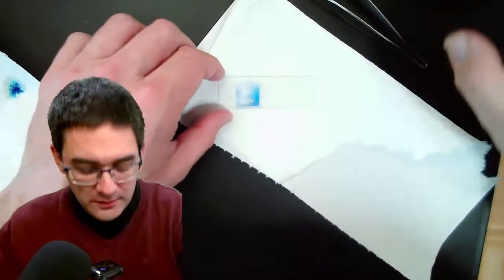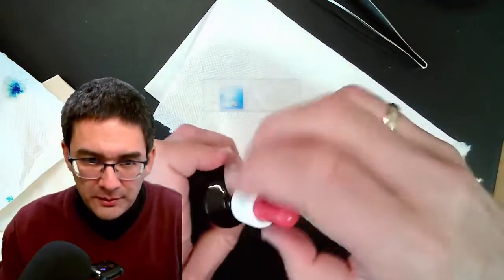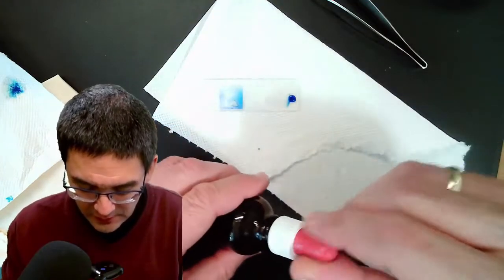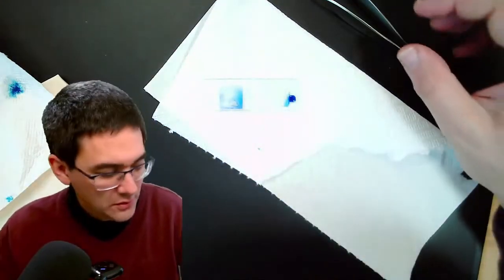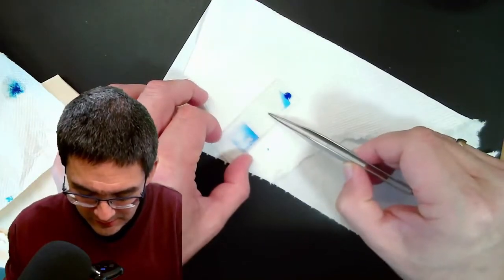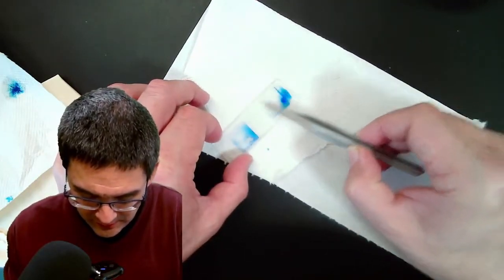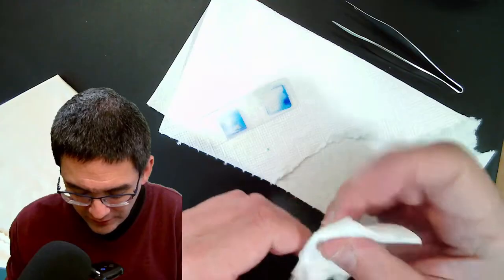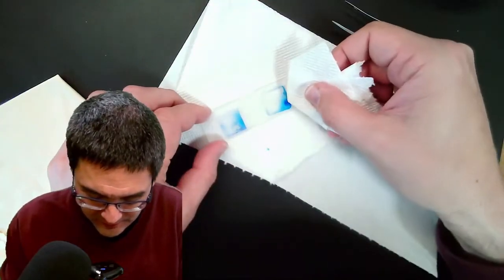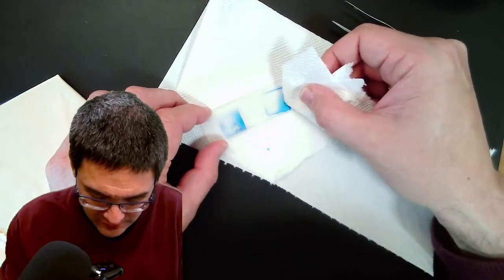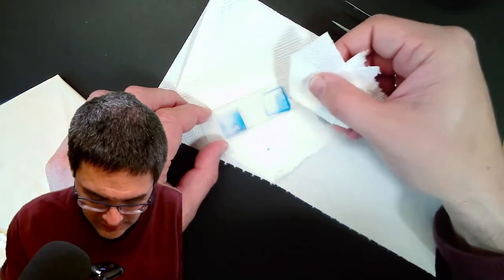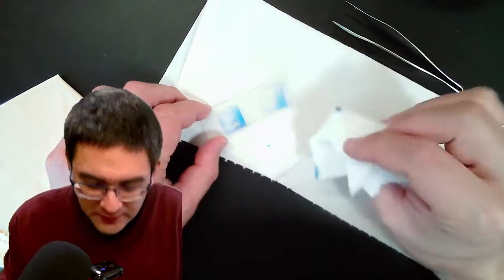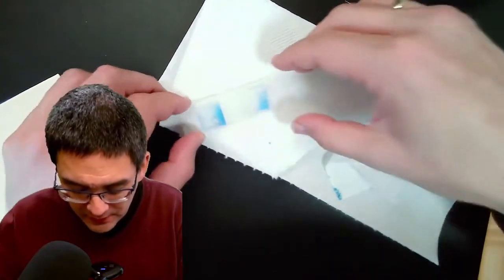Here we go again. So let's try the other one. And yeah, it slowly starts to diffuse in. So let's speed it up a little bit. Like this. And of course I definitely have to remove this one over here because again, any excess has to be removed. So let's give this here a try.